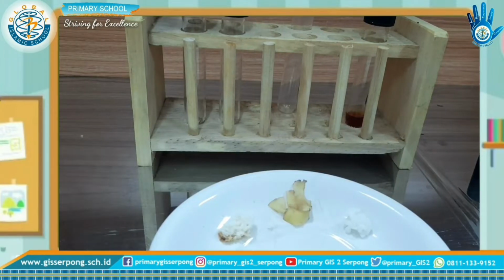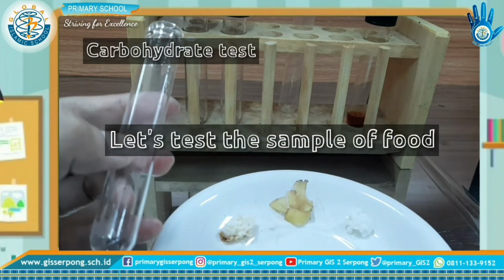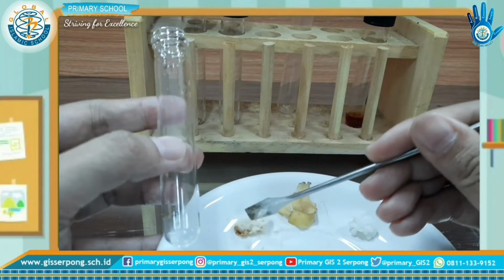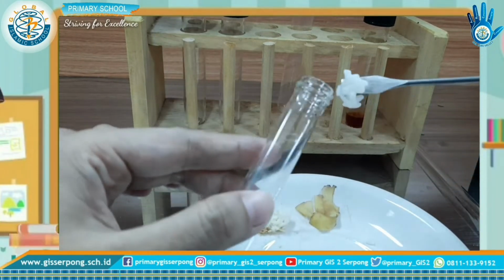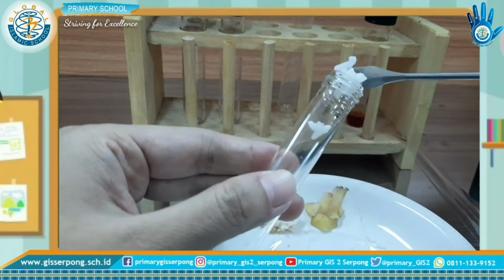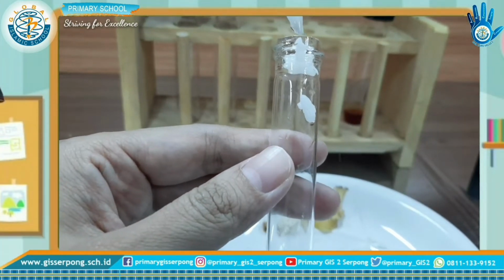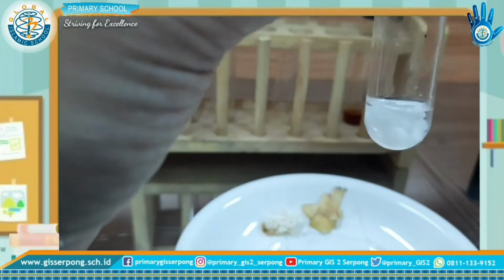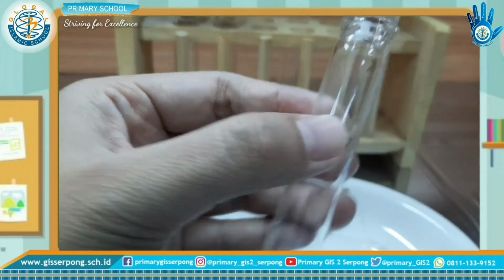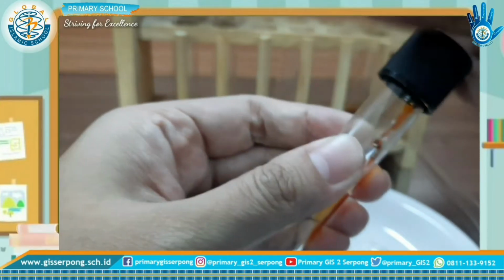Okay, after you make a control solution, next let's test the sample of food and put the sample into the tube. I use rice and add some water and add a few drops of iodine solution, just one, and shake it.